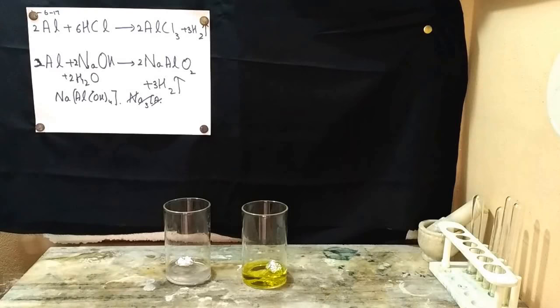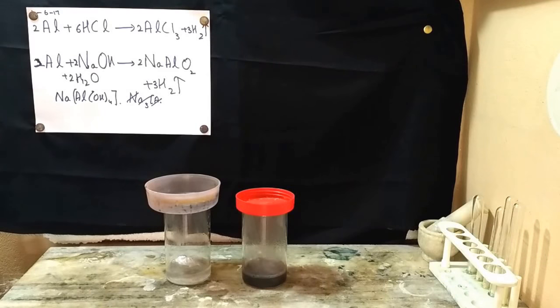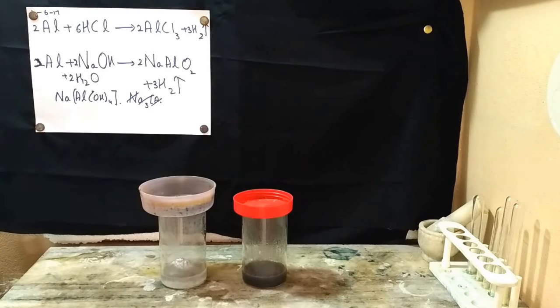There's one thing which would be happening when we use aluminium foil as a source of aluminium. There's a formation of this layer of oxide which is on the aluminium foil. So it takes some time for the reaction to start. As you can see, the hydrochloric acid reacted very vigorously, and the reaction has proceeded very quickly, and sodium hydroxide is taking its own sweet time for the reaction to proceed, but you can see that aluminium over there is also reacting.